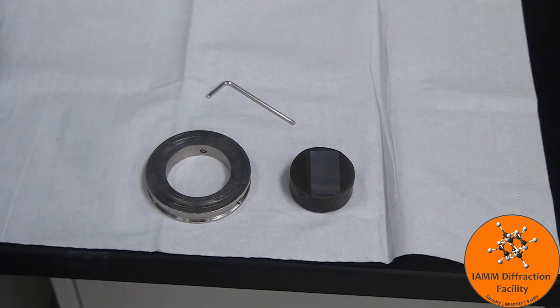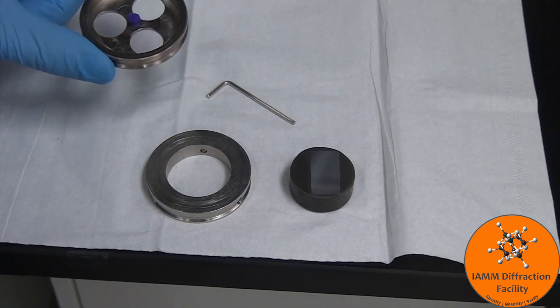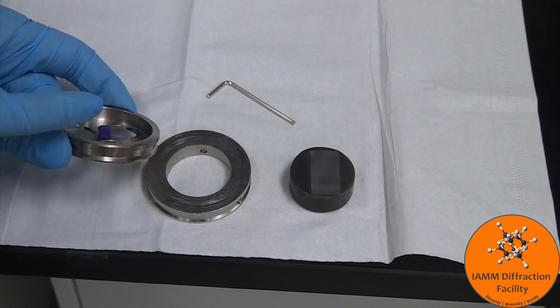I can never remember which orientation is correct for top and bottom. You could either, once you figure it out, mark the top or just grab some other sample holder like my solid sample holder here where I know the orientation.